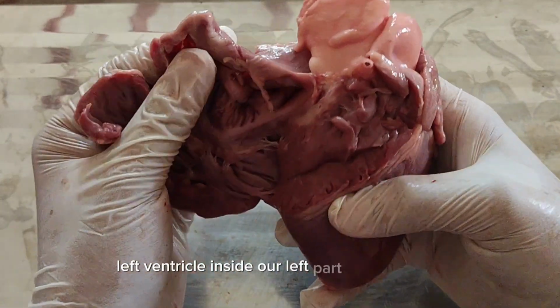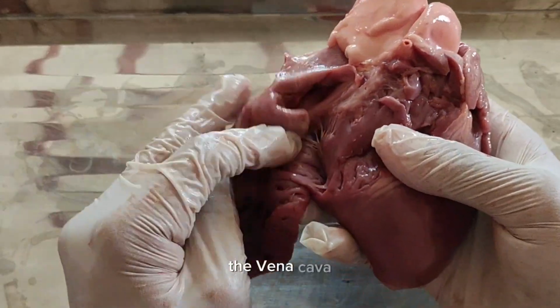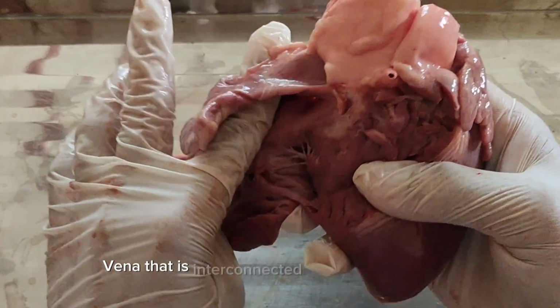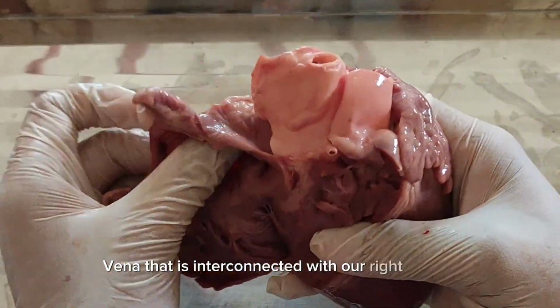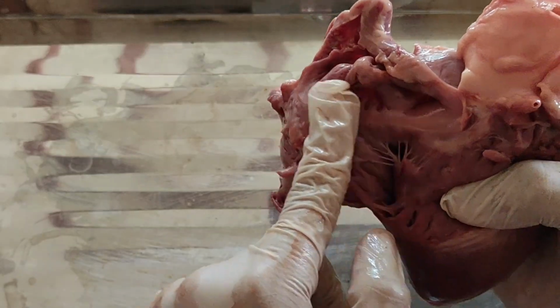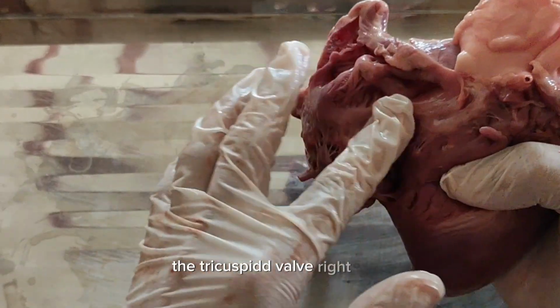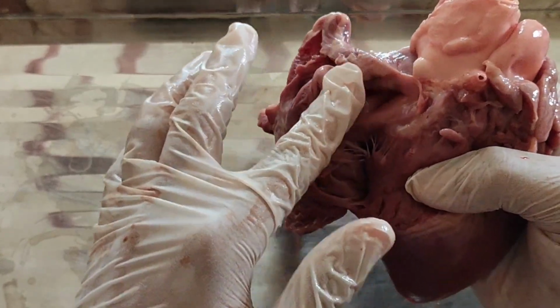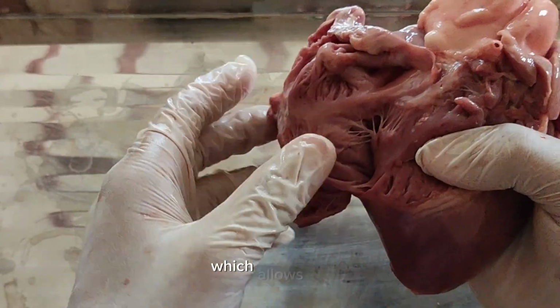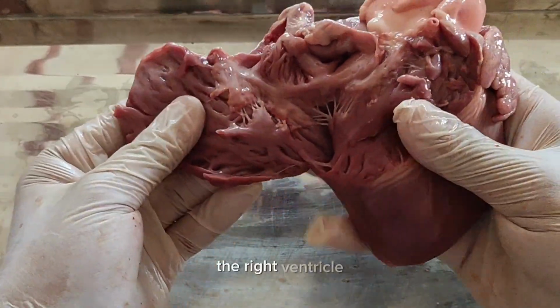Inside our right part, we have the vena cava, which is interconnected with our right atrium. And here we also have our tricuspid valve, which allows blood flow from the right atrium into the right ventricle.